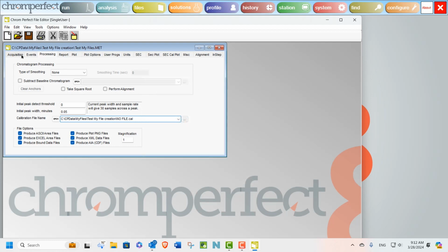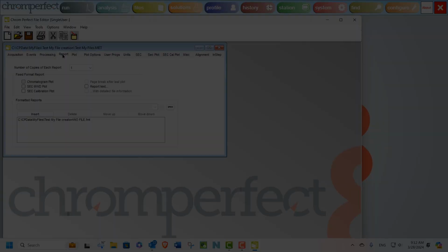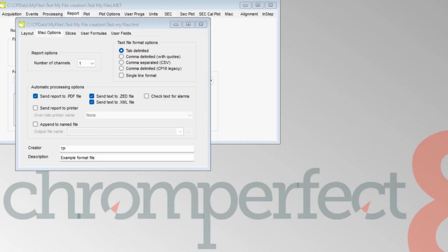Another supporting file which can be called to produce additional auxiliary files is a formatted report. These format files are also listed within the method and have the extension FMT. If we quickly open a random format file and switch to the Miscellaneous Options tab, automatic processing will also create a PDF, a text, or .ZED file, as well as an XML file.